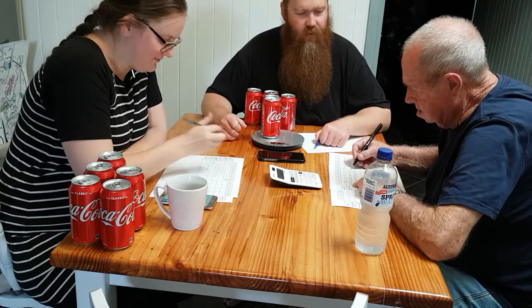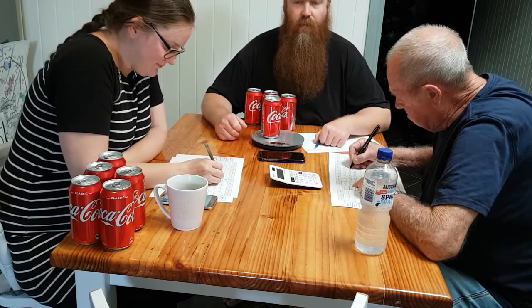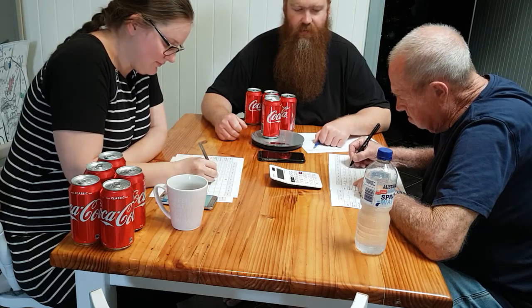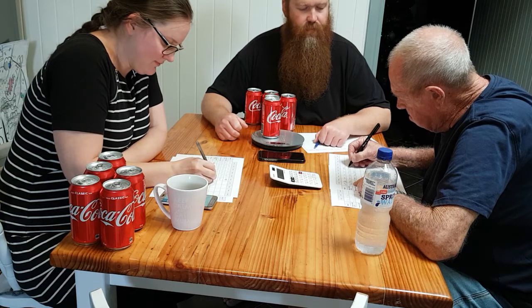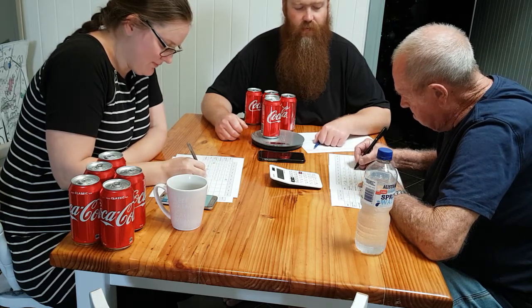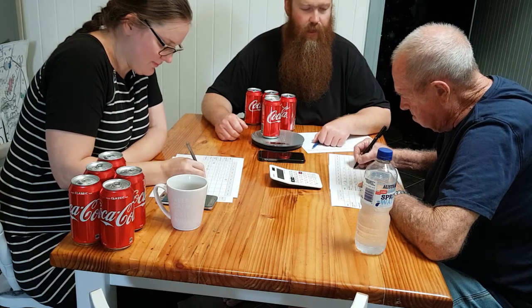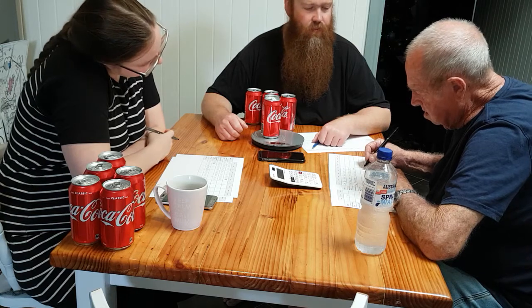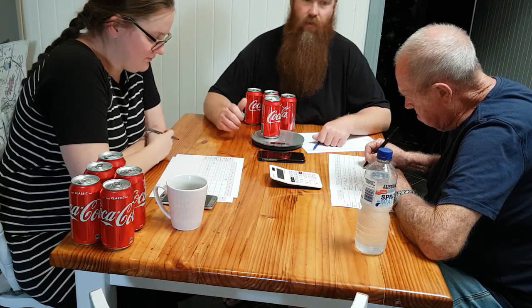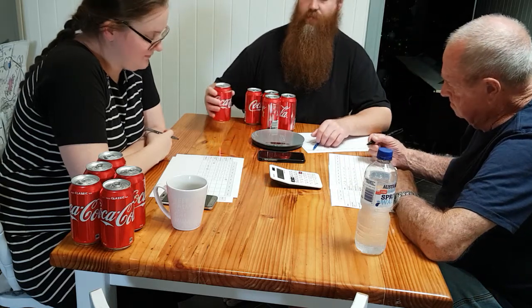Now we can copy the first one because the calculation is going to come out exactly the same, again due to the lack of sensitivity of these scales. When we use the correct scale equipment though, it will give different decimal point readings most of the time. You can still get some that are identical, which is due to the nature of how they're filled in the filler bowl.